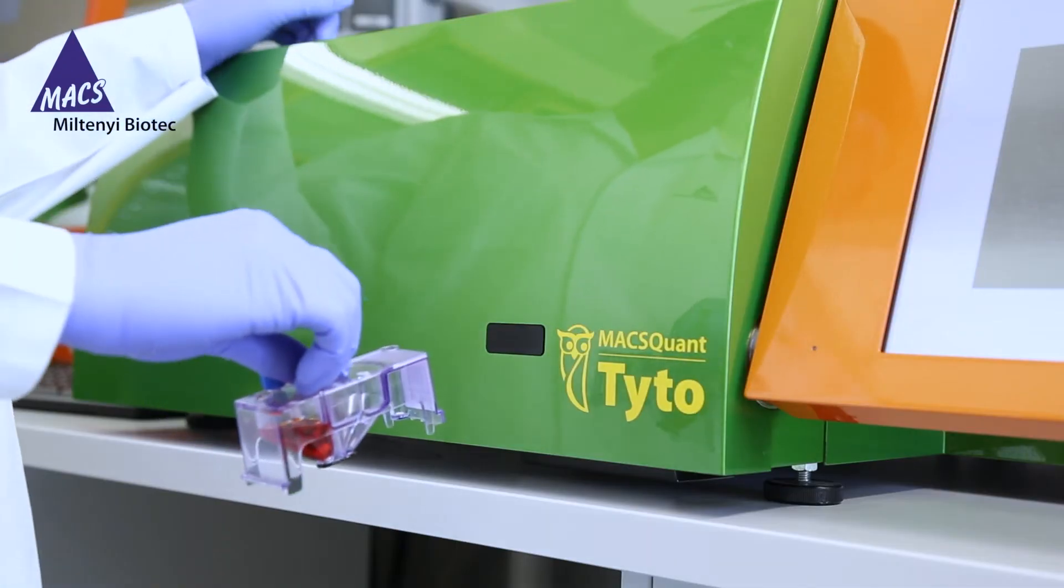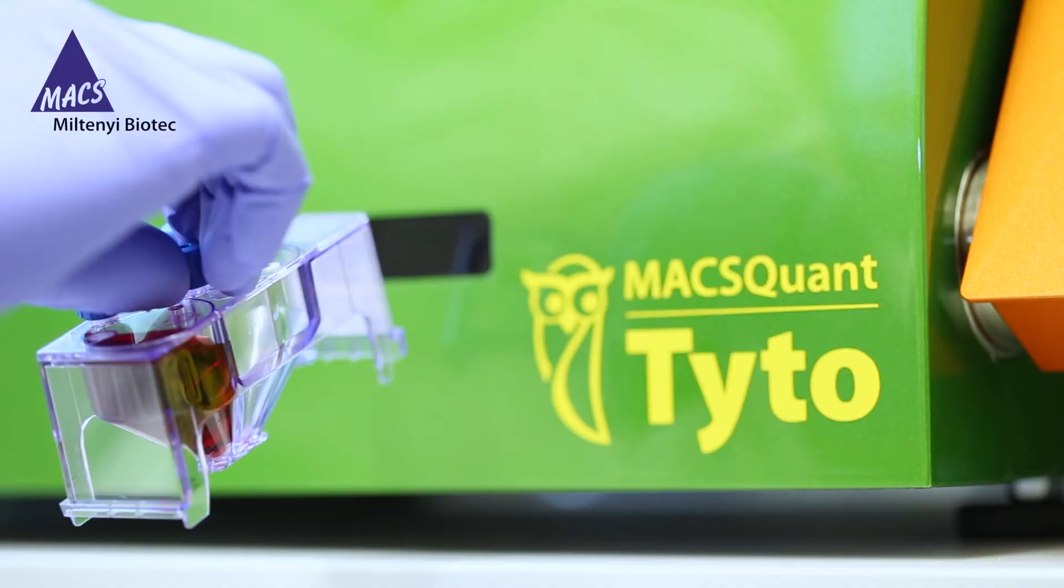You can scan the barcode on the cartridge for automatic recognition of the cartridge type and settings.